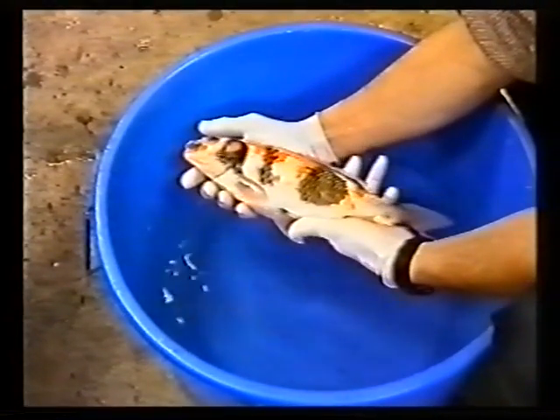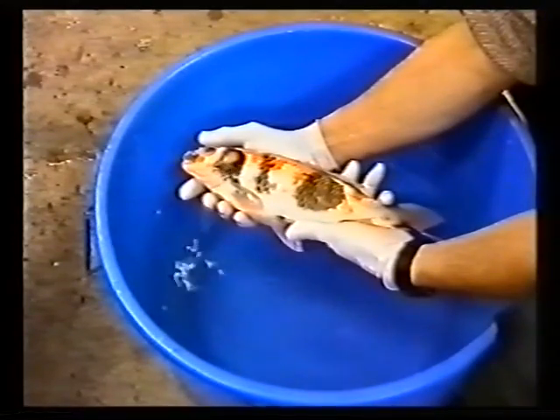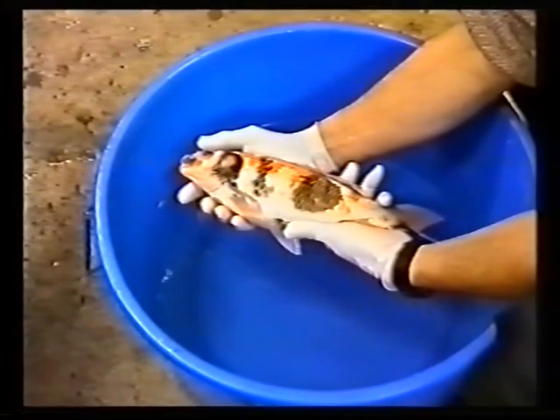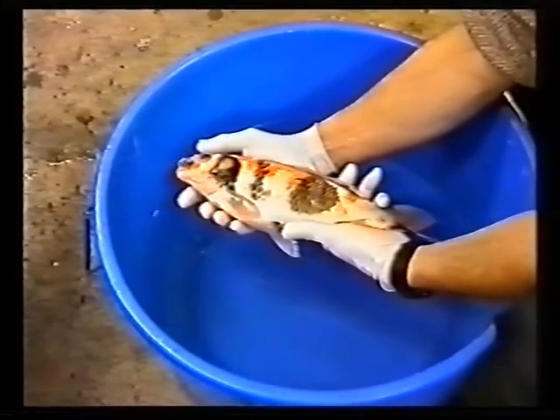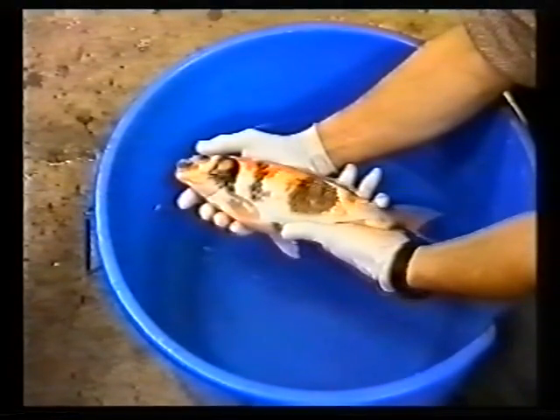Raise the fish out of water, spacing your hands underneath it to evenly take the weight. Hold it in that position for about 10 seconds. If it flips, replace it in the sedative and try again after a while longer. Once the fish remains quite still, you can then proceed. Always remember to wear rubber gloves when handling fish, making sure that they are wet.